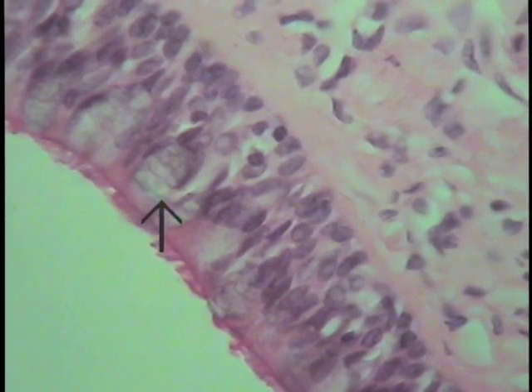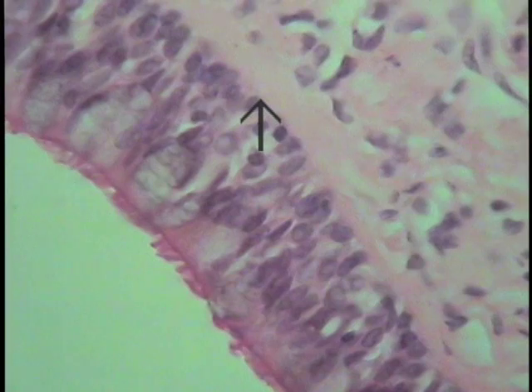Also, one can make out the little mucin granules of goblet cells, and one can more easily see the three layers of cells, sort of a columnar epithelial profile here, if one compares it to the profile of the nucleus. A little rounded group of cell nuclei here, and another cell layer here, these so-called basal cells. Nonetheless, all these cells reside on the basement membrane located here, so it satisfies the definition of being a simple columnar epithelium, though it's given the name pseudostratified columnar.